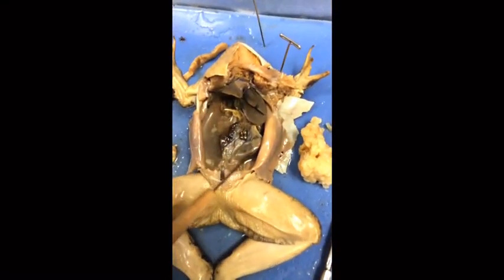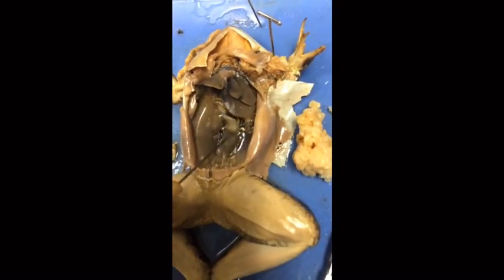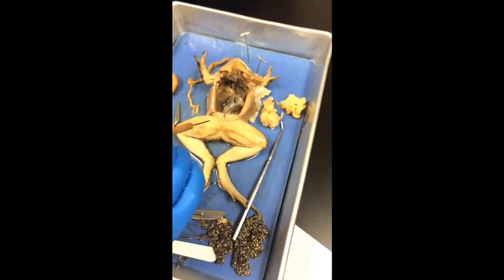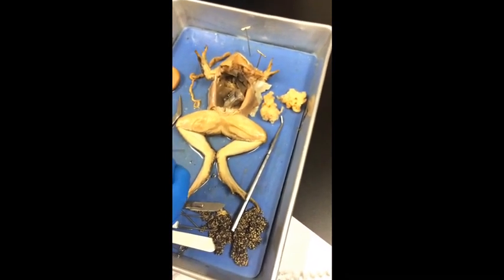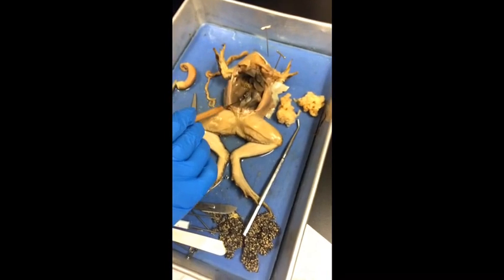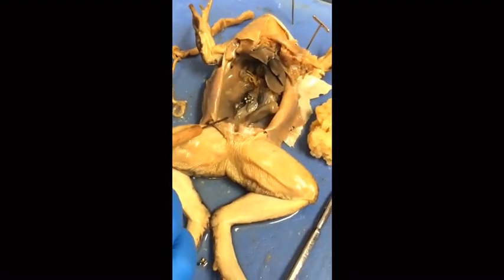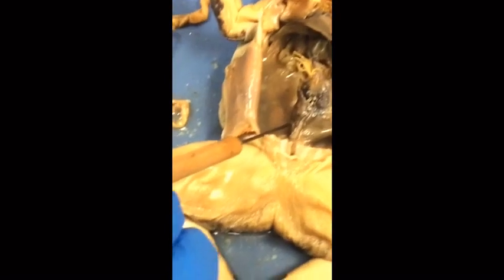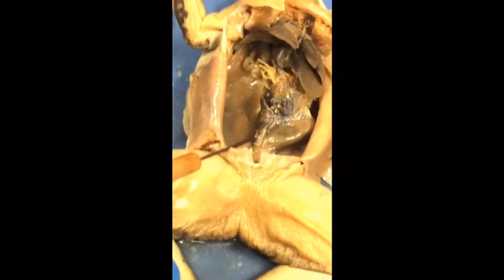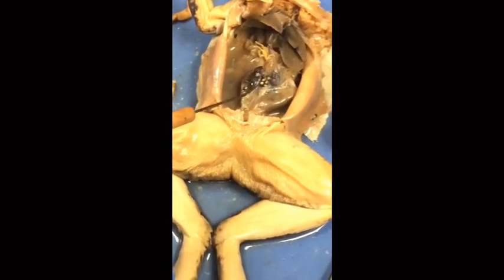Here are the kidneys — this is one kidney and here is the other. The kidneys filter the blood, remove excess water, salt, and unneeded nutrients, and also reabsorb them when needed. The kidneys also make urine, which empties into the bladder through the ureters. The ureters are this vein-like structure right here and they empty into the urinary bladder, which stores and excretes the urine.